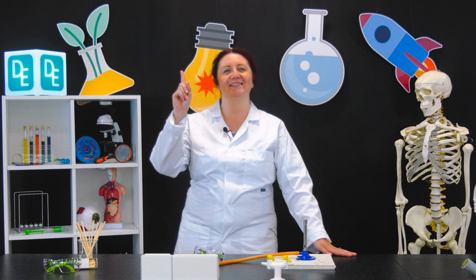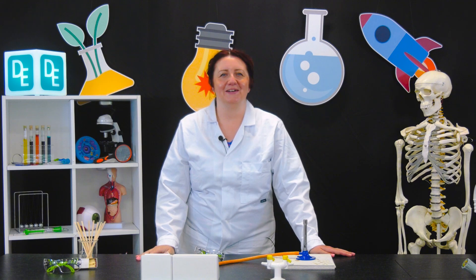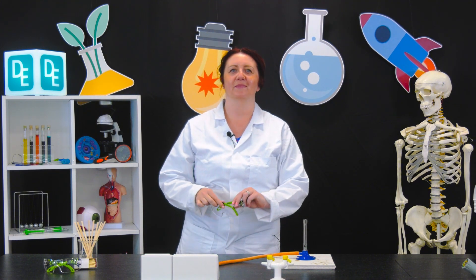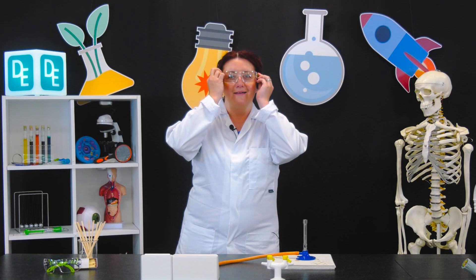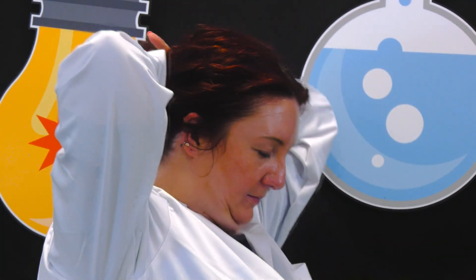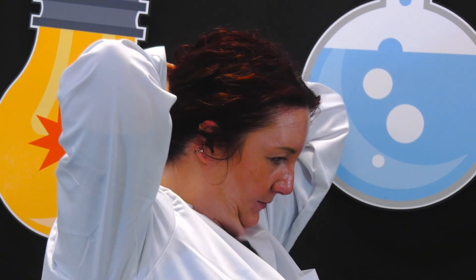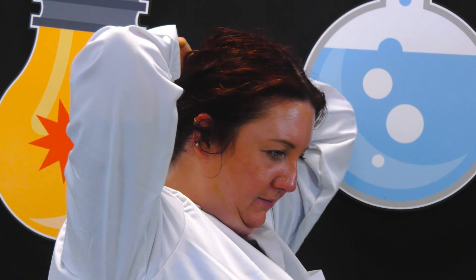Safety first. Before using a Bunsen burner, make sure you're wearing safety goggles. If you have long hair, tie it back to keep it away from the flame. If you have a tie as part of your school uniform, make sure it's tucked away too.